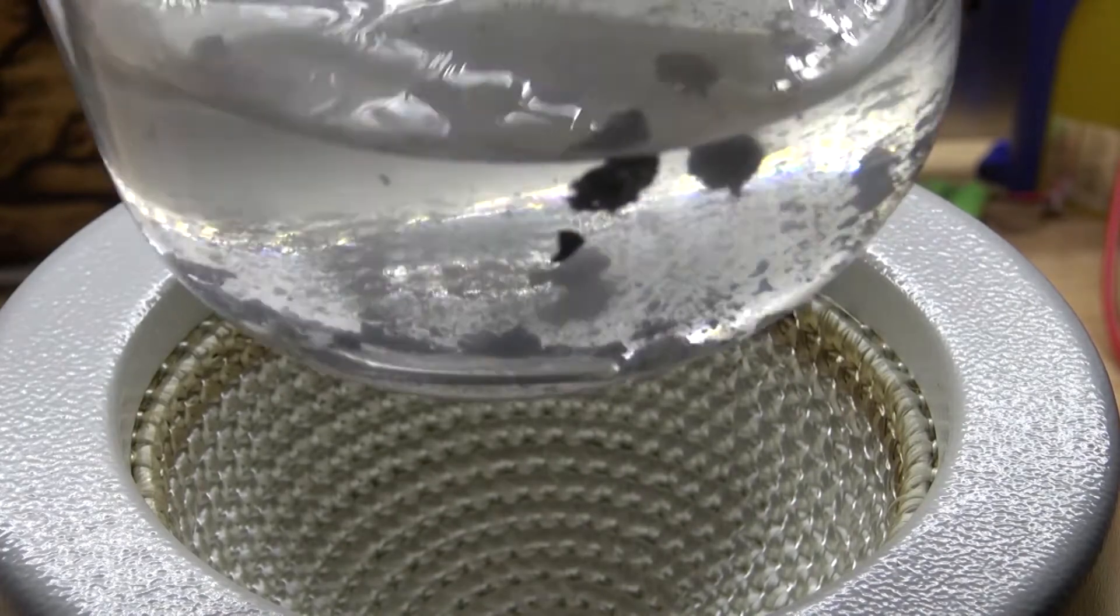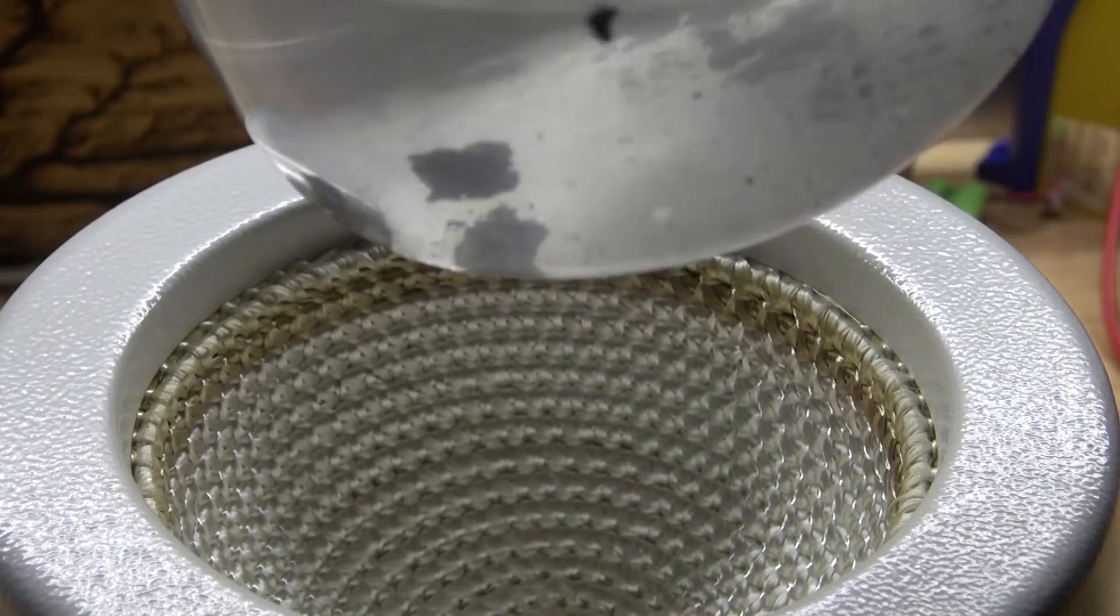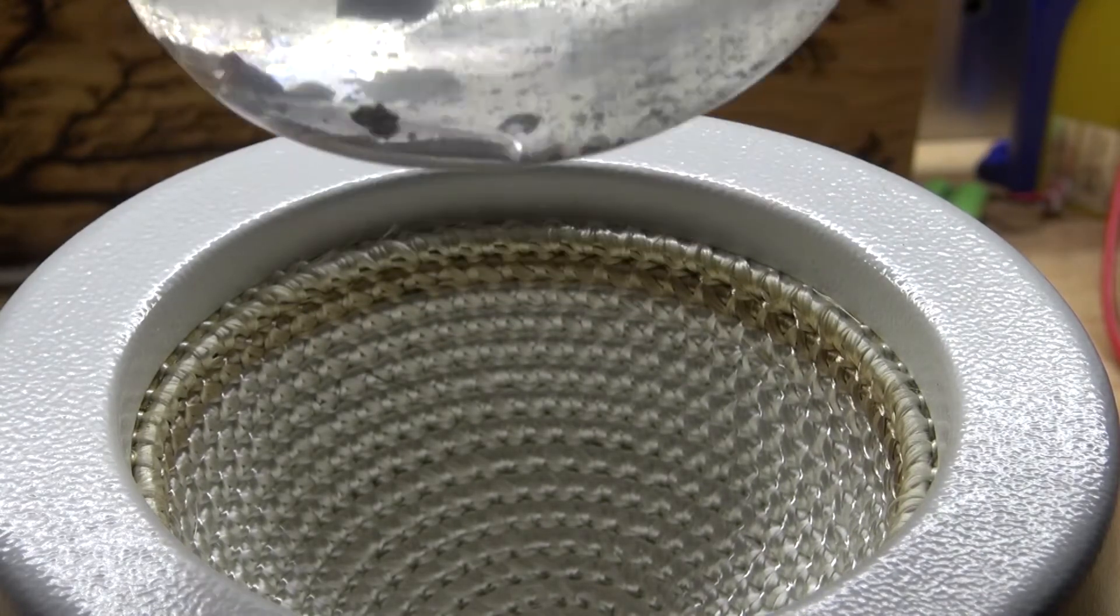What's left inside floating around is just aluminum oxide and a few other impurities that did not dissolve in the water. What's left is just pure gallium.